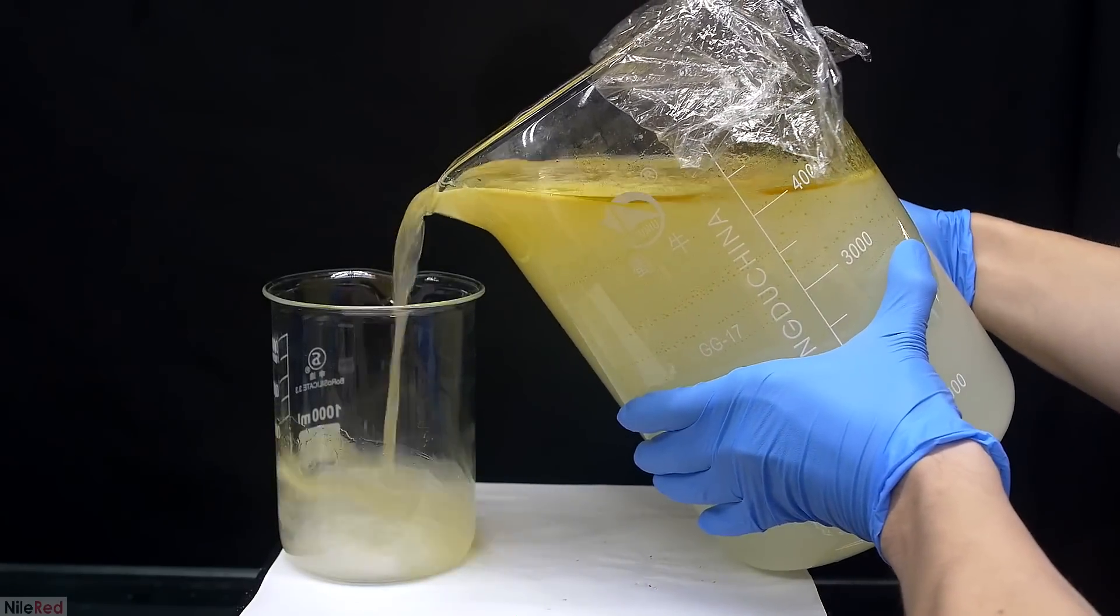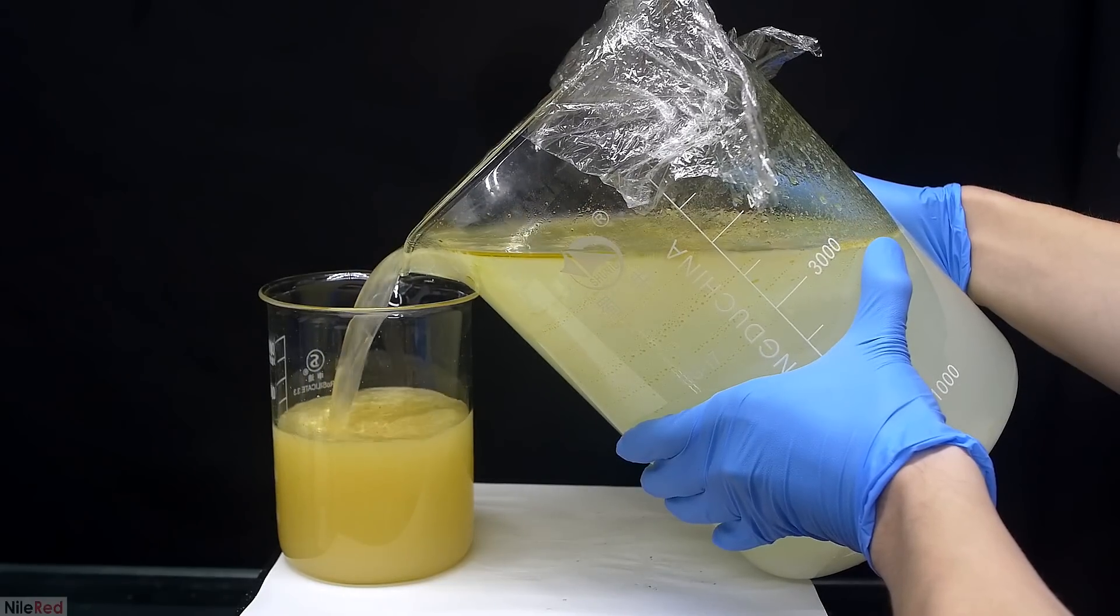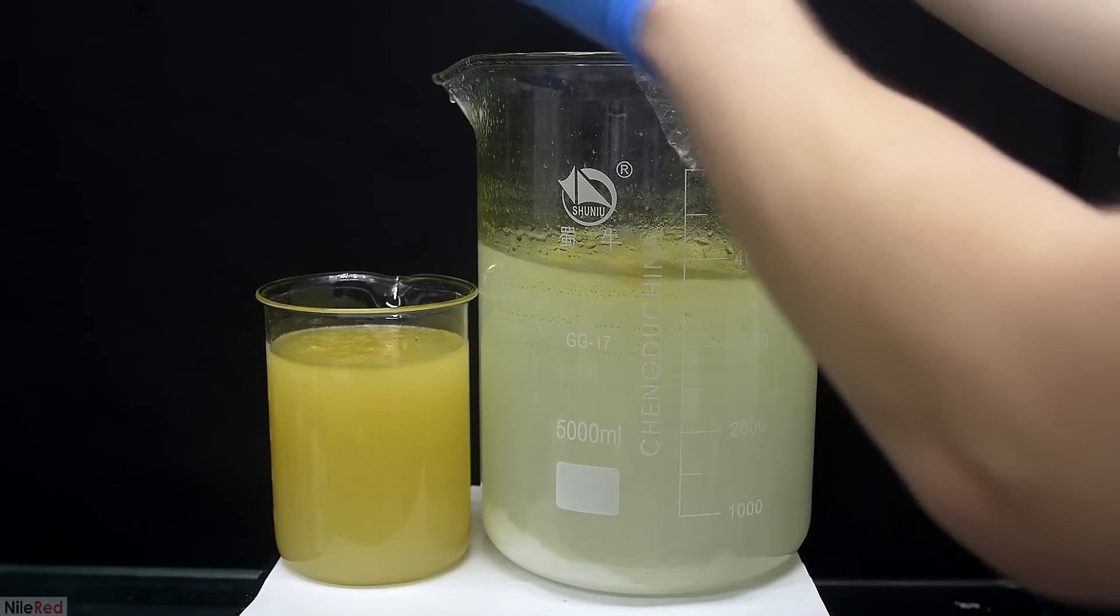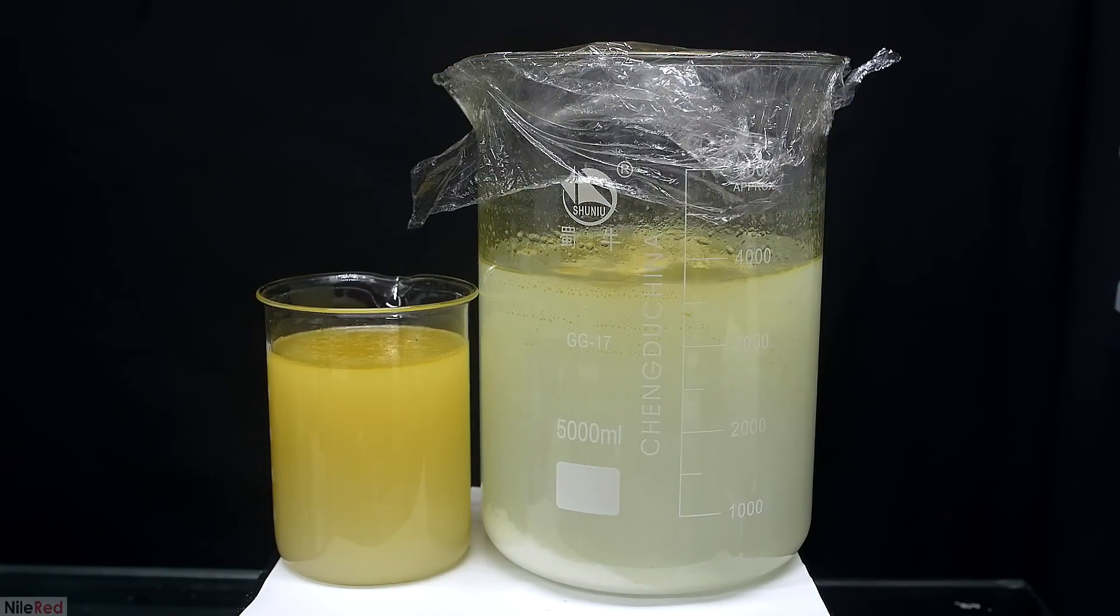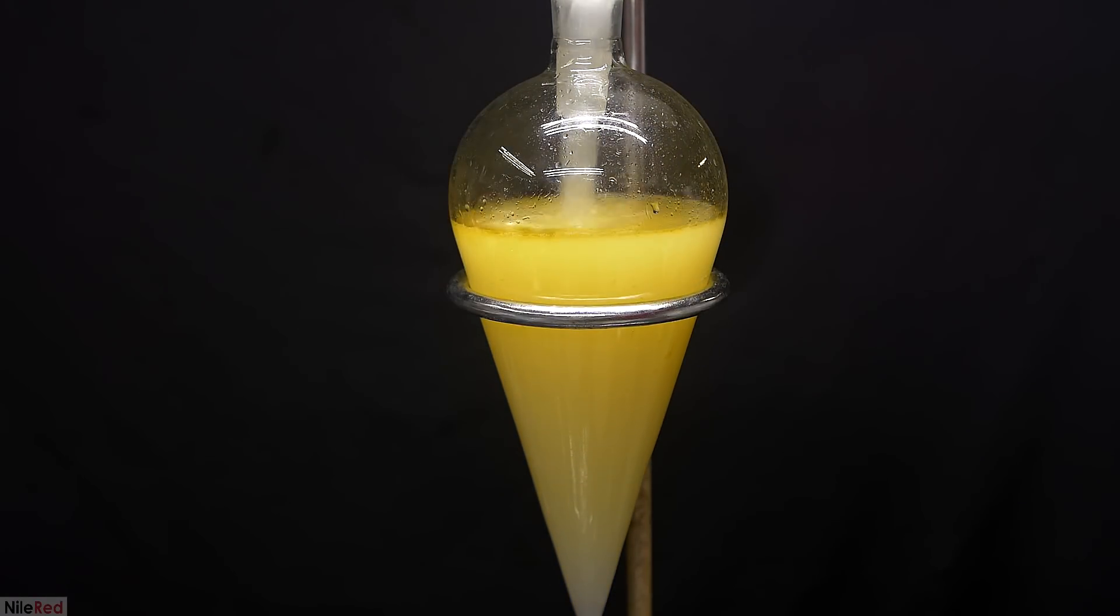We're only really interested in the oil floating at the top and the rest of the water is kind of useless. I really didn't want to have to handle this much water and pour it into a separatory funnel, so to make things easier I first decanted it into a beaker. The contents of this smaller beaker was then transferred to a separatory funnel.